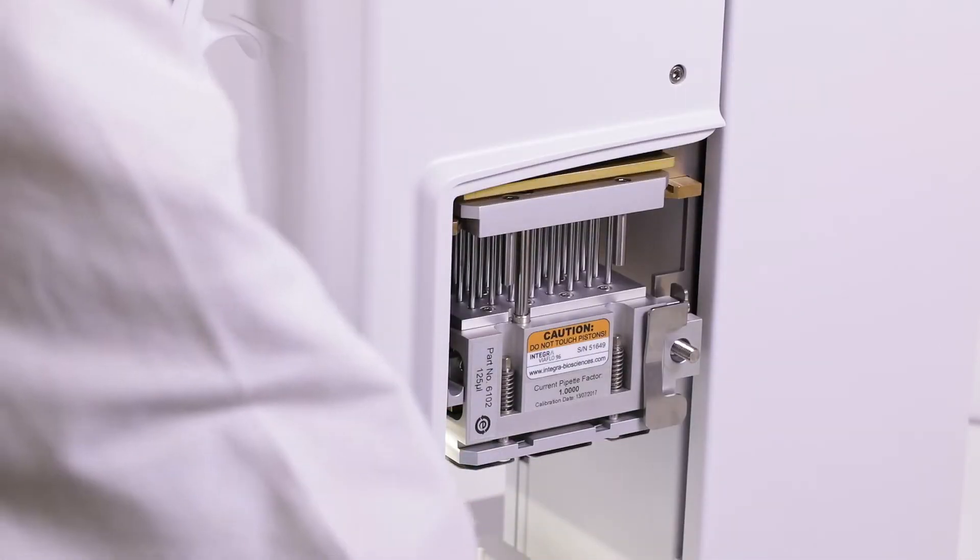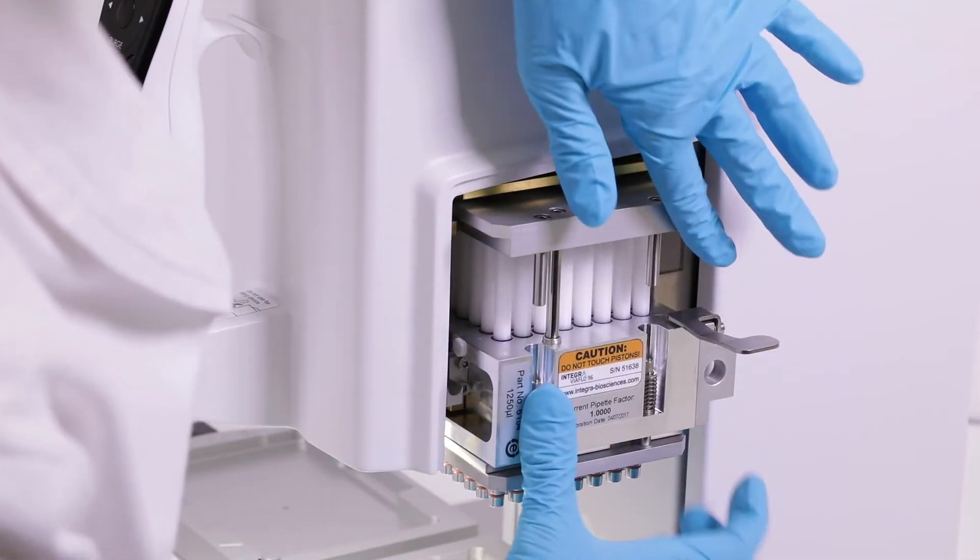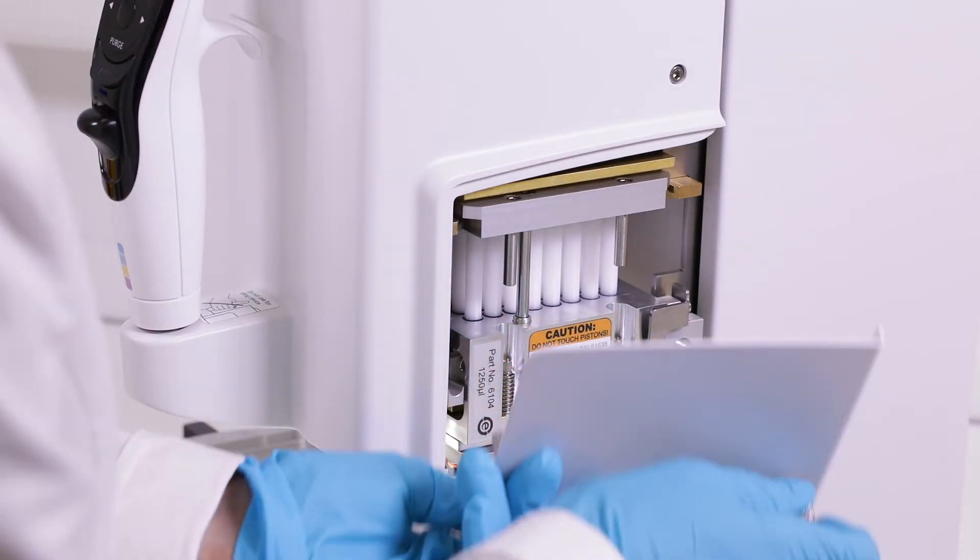Exchanging a pipetting head is fast and easy. Remove the side cover and the pipetting head, simply slide in the new pipetting head, place the cover back on and that's it.